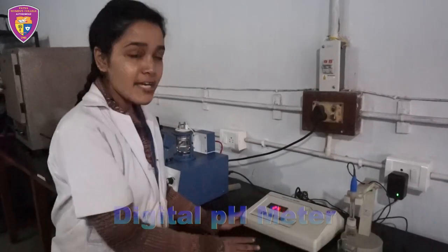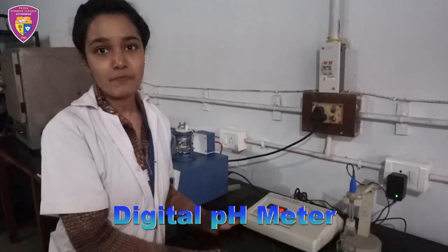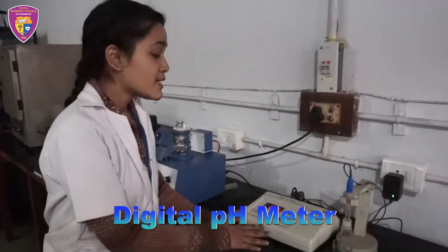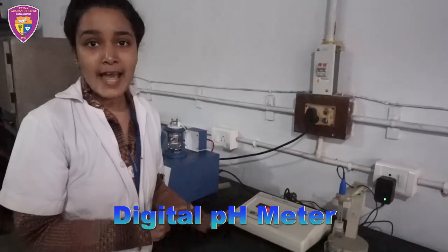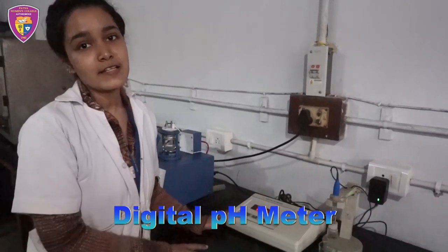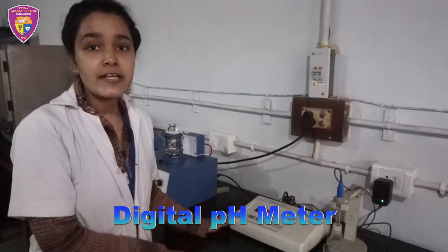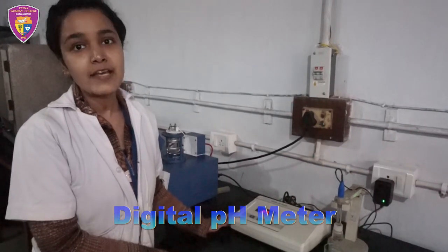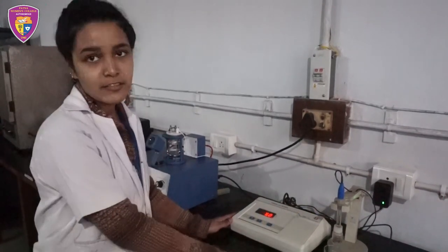This instrument, the pH meter, was developed based on measuring hydrogen ion activity in a solution. It basically measures the acidity or basicity of a solution digitally.